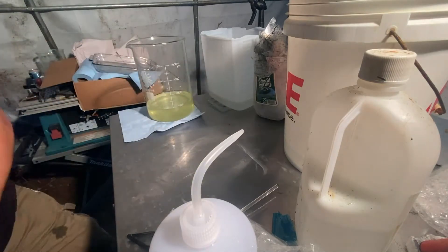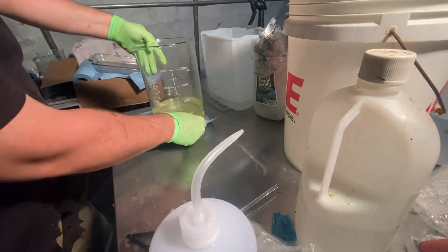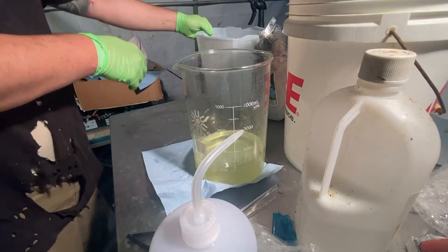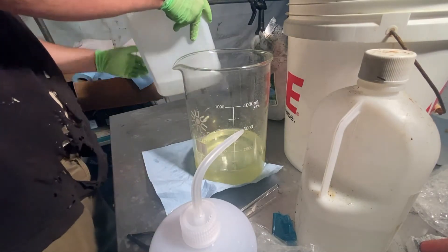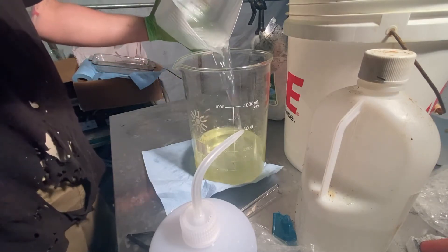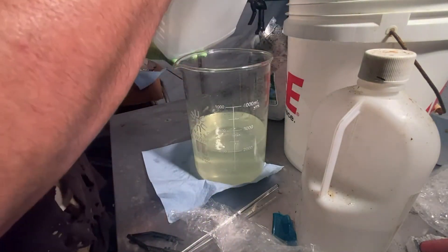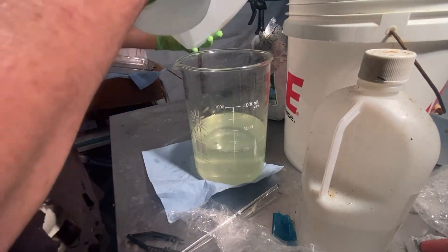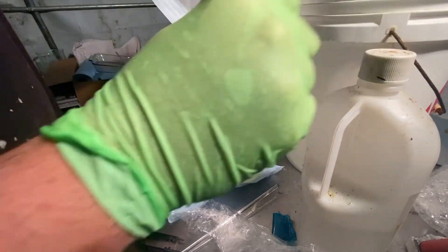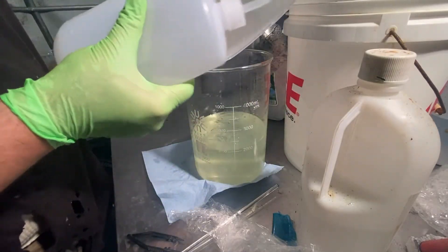Just using that to level it out. This is what I rinsed the mylars off in — distilled water — we're going to add that to it. And we're going to rinse it with just some distilled water and get every little bit that's in there out of there.